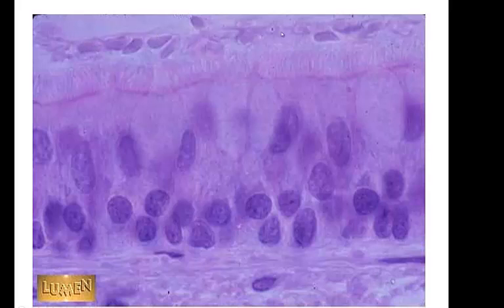This is a bunch of mucus and other cells being brushed along the top. So here's our cilia. This is pseudostratified, ciliated columnar epithelium. And I actually see mucus cells up here. Here's a goblet cell. Here's a goblet cell. So these cells are secreting mucus to push up here for our cilia to brush along. This is pseudostratified, ciliated columnar epithelium from the point where my mouse is going all the way up top. And it appears to be in many layers, but it's just one layer. This is debris up here that's being pushed along. See the cilia?